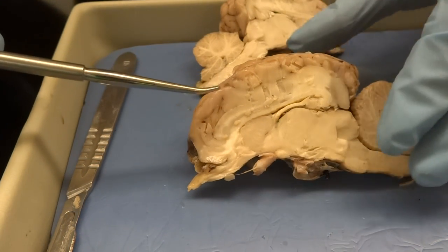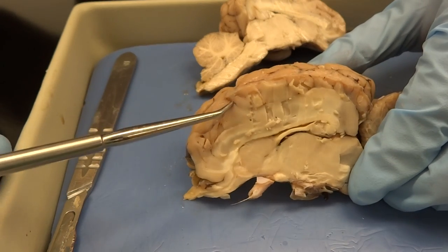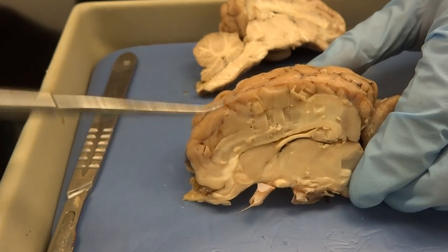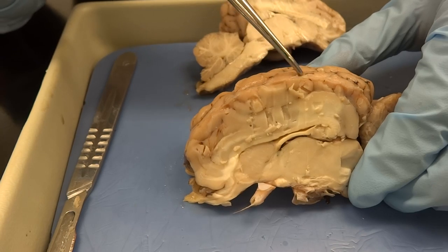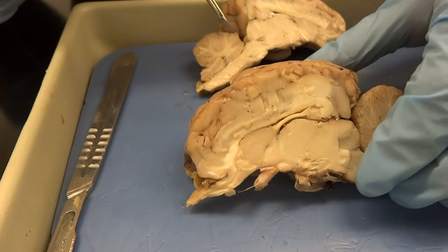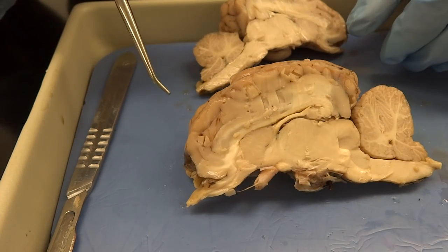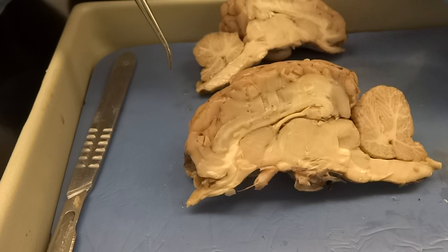You can also see the meninges a little better here — it looks like a little bit of saran wrap. That's going to be the arachnoid mater, and then the pia mater we can't see very well since it's just attached directly to the brain.